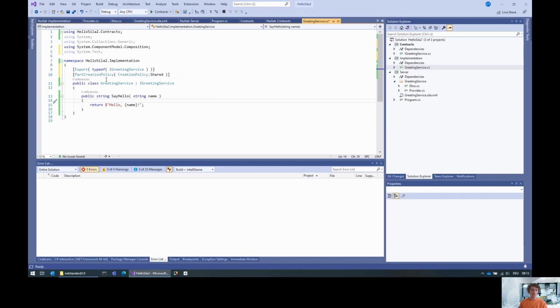So this basically says, okay, if you scan this library here, then this class is noted as an export of type iGreeting service, and you should only create one instance for it, regardless of whoever asks. I mean, this is not so important for this implementation here, because it doesn't matter whether you have one instance or multiple of them. But for other cases, this is more useful.